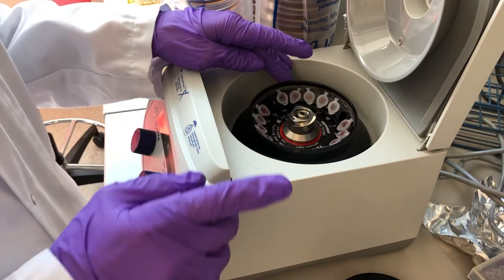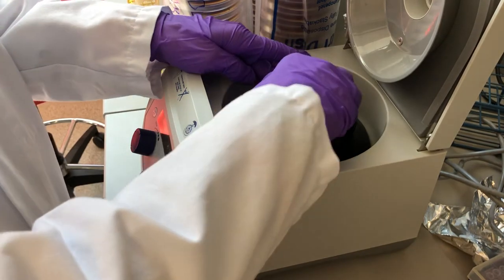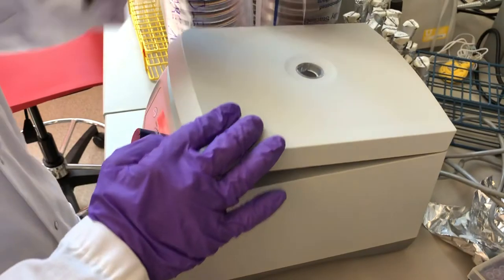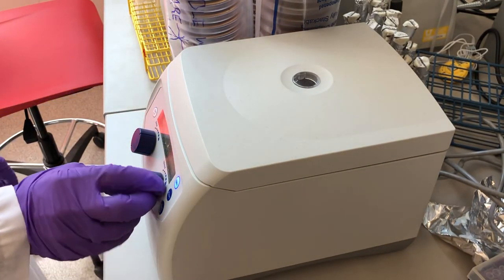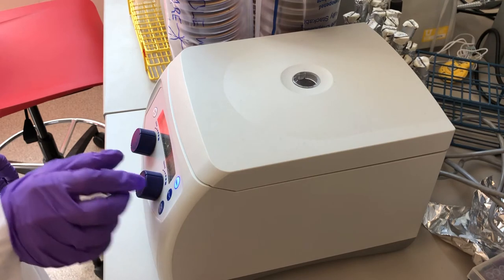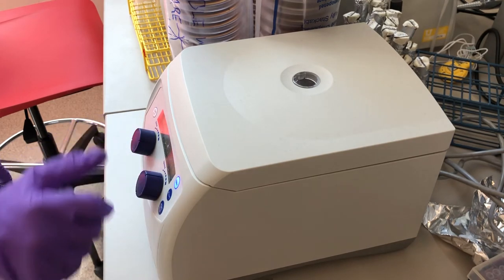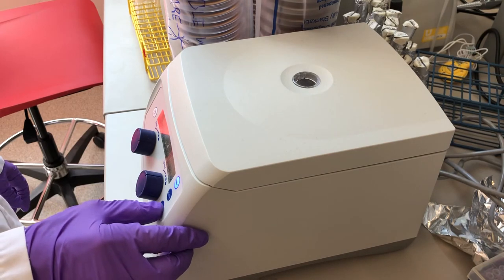This will create a balanced rotor situation. Click the lid into place, close the lid - that nice satisfying sound. I'm going to set the rotor to 5000 RPM for two minutes. That should be sufficient to collect all of the cells. And I hit the start button.